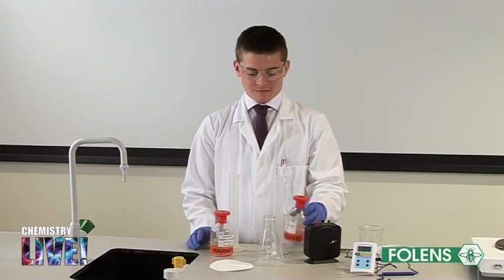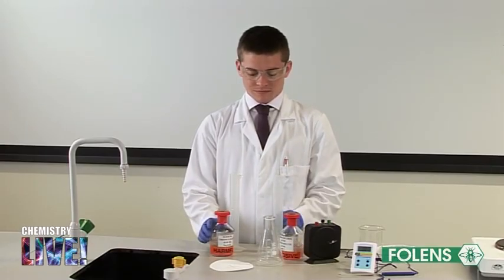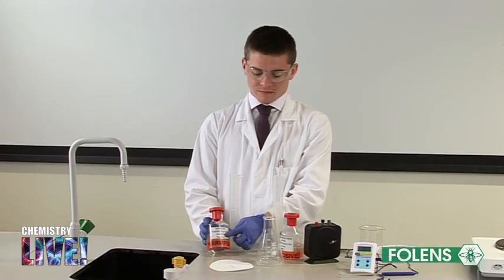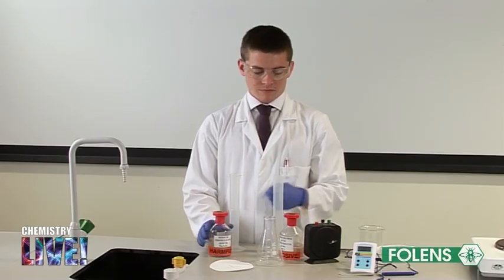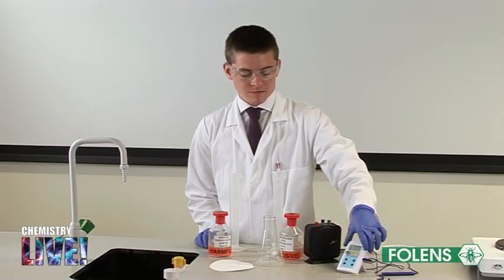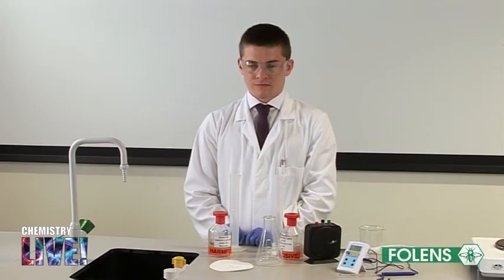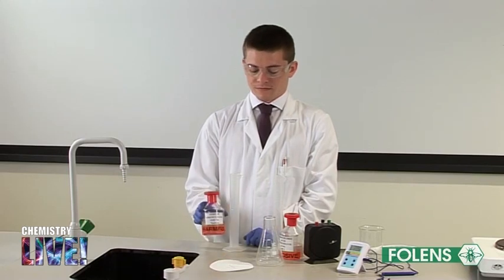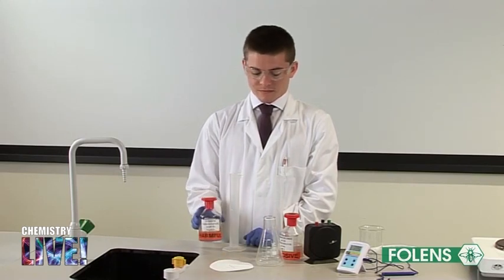However, we will use just one concentration of sodium thiosulphate solution, but at different temperatures. We will use quite a dilute solution of sodium thiosulphate in this experiment so that the measured times will not be too short at the higher temperatures.